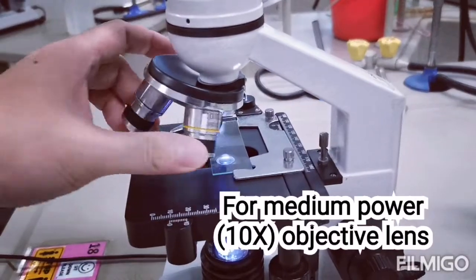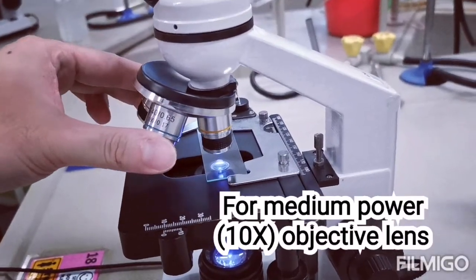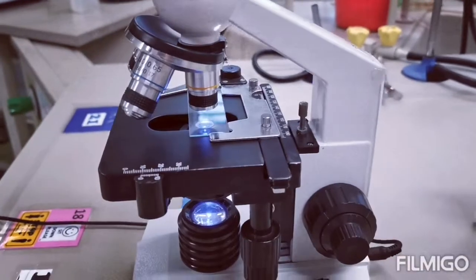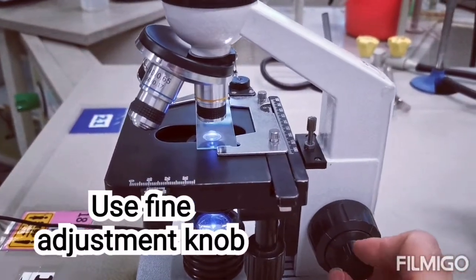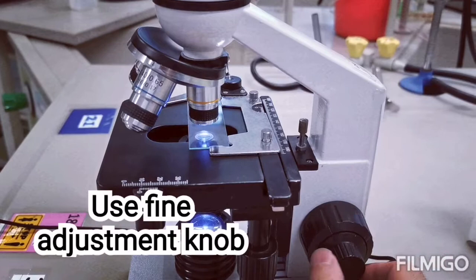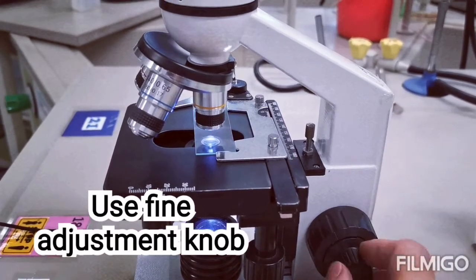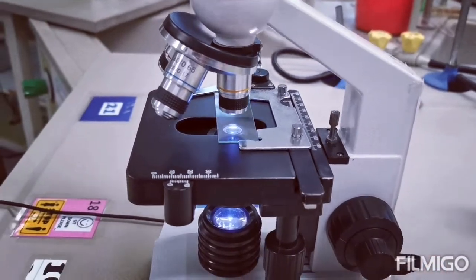If you are using the medium power objective lens, or the 10 times objective lens, we would try to obtain a focused image using the fine adjustment knob, as the stage is already quite close to the 10 times objective lens.